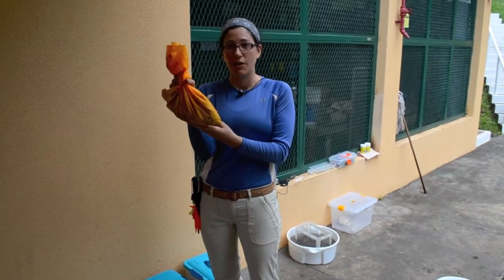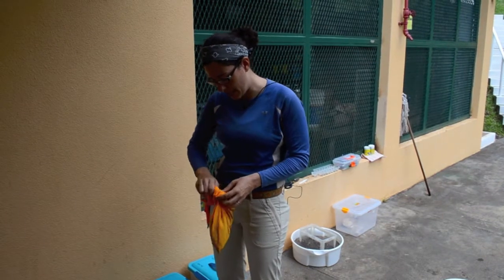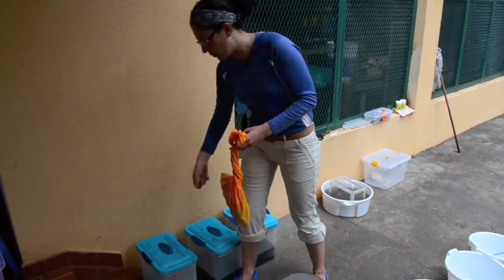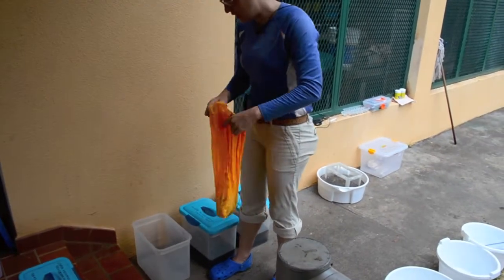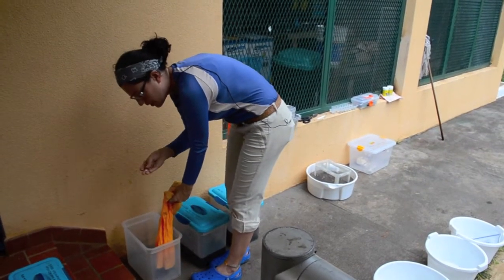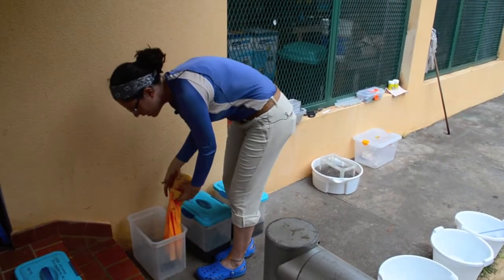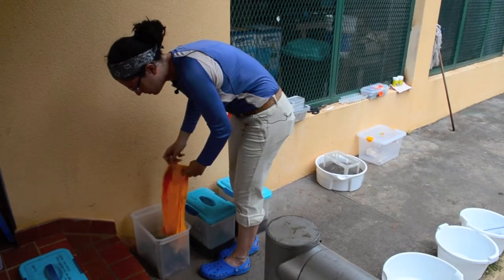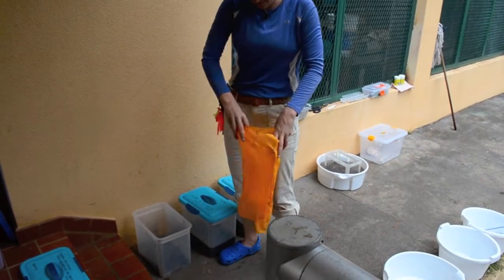So here's a sample. And the first step is open it up. And these boxes are for the sample to soak. So the soil that is stuck to the leaves needs a little bit of time to loosen up. So the first thing I put in here is this little piece of plastic that has the sample number. It's the same as the number on the bag so that they don't get mixed up. It's really important to not mix them up. And then some of the sample gets stuck to the bag.